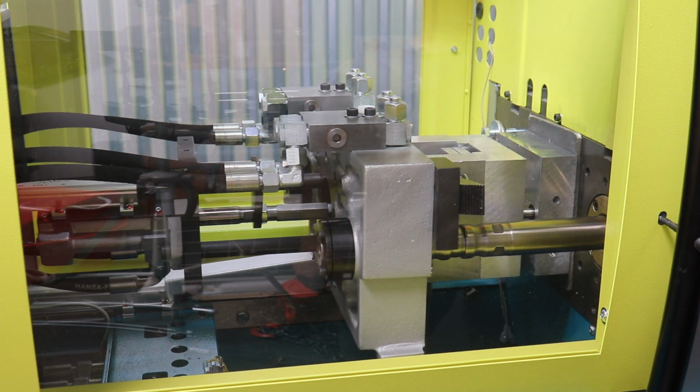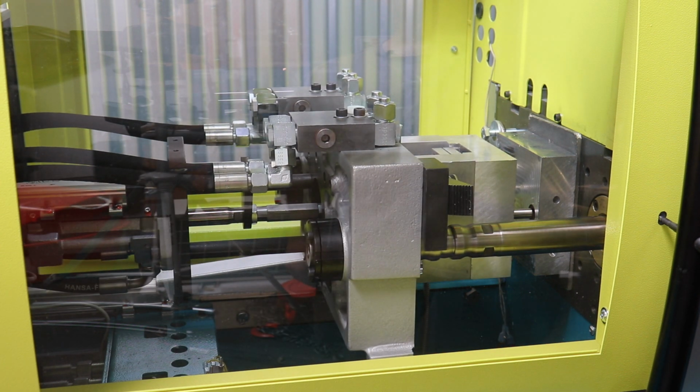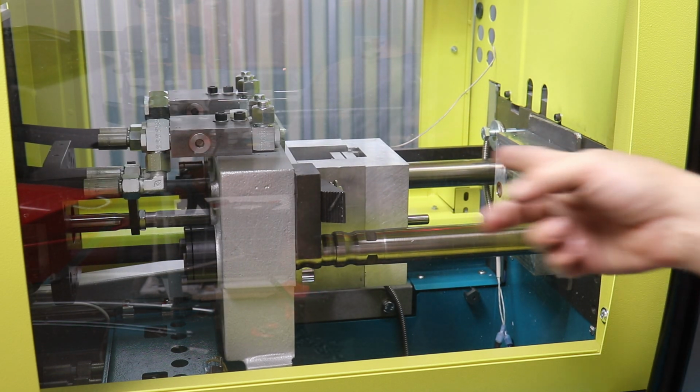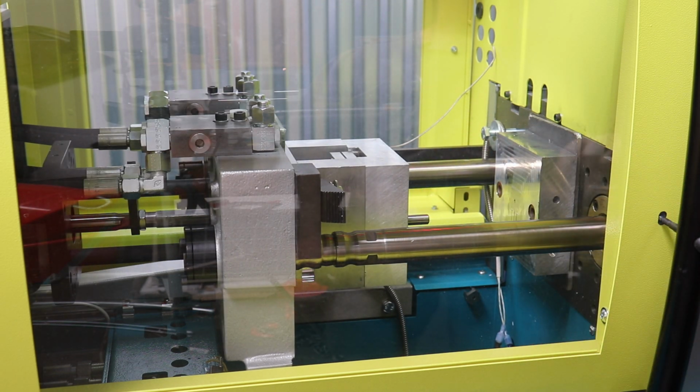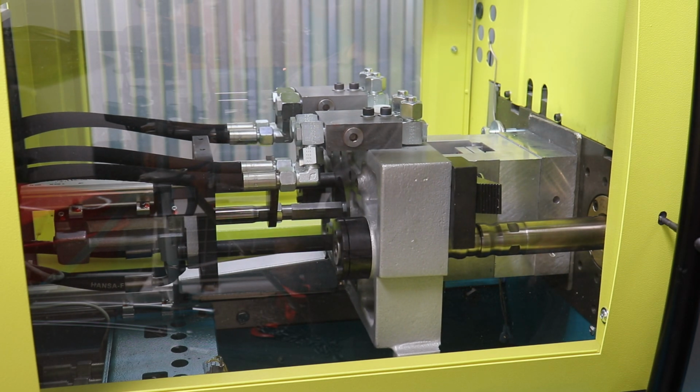It looks like the mold safety pressure needs to be increased a little bit. Let me hit manual mode. So the molding machine, this mold's a little tight since it's new. So I need to increase the clamp pressure because it's sensing that it thinks maybe something's stuck between the mold. So we'll do 470 and 470. Now I hit semi-automatic mode and we'll see if it clamps up. No, not yet.